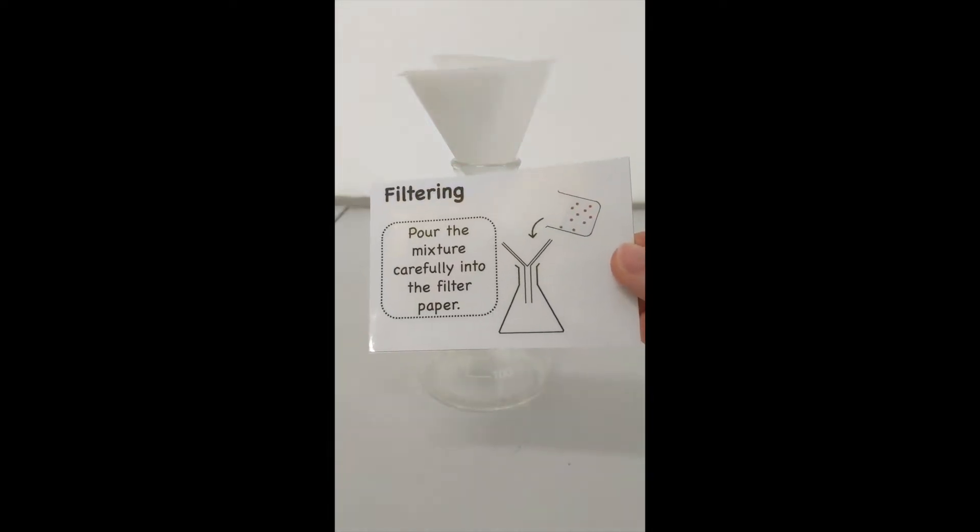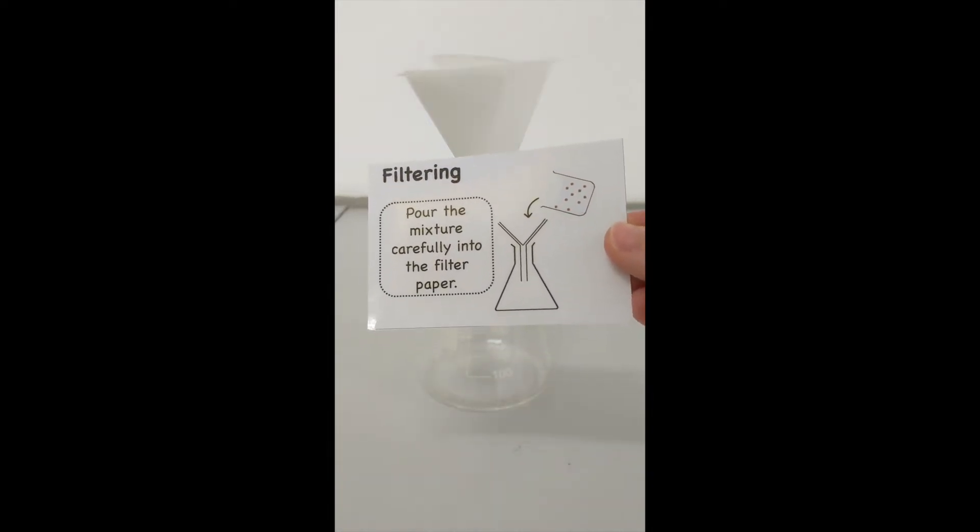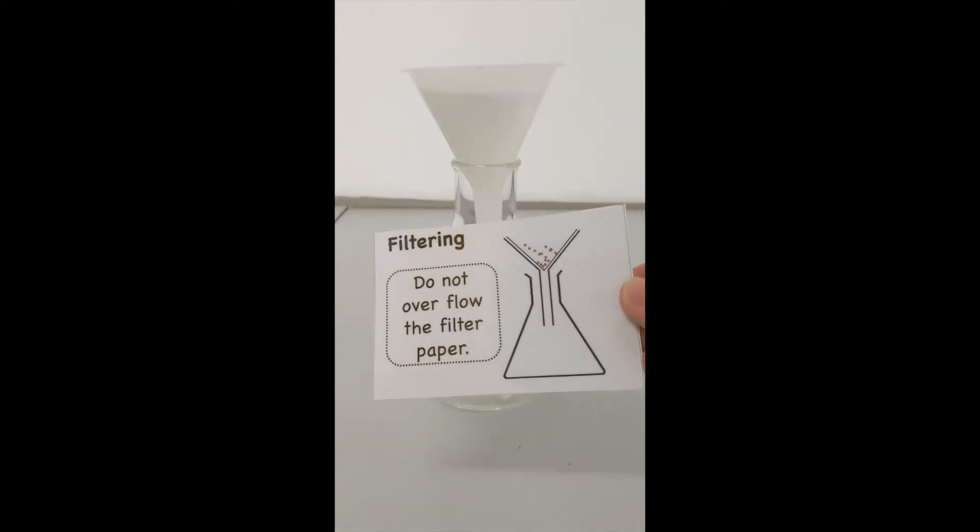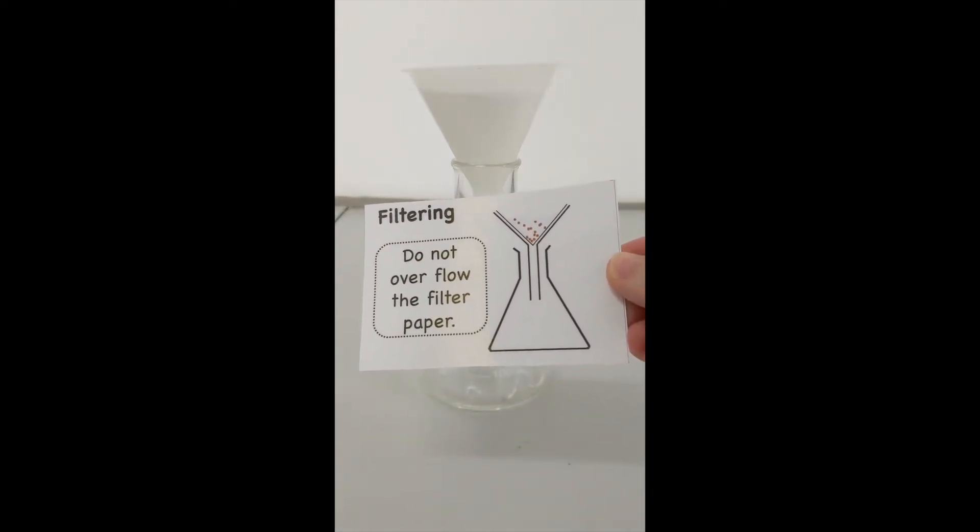I'm going to carefully pour the mixture into the filter paper. I have to be careful not to overflow the filter paper.